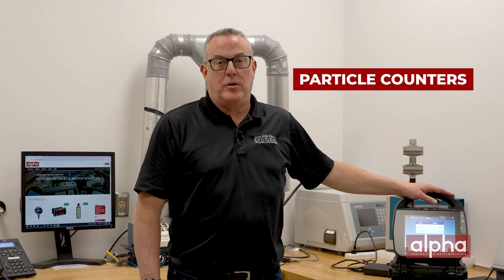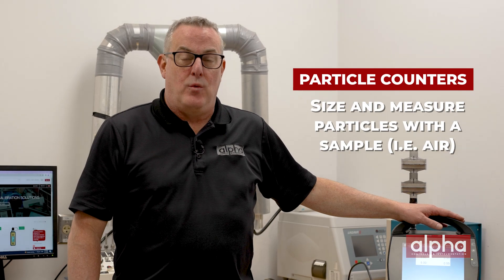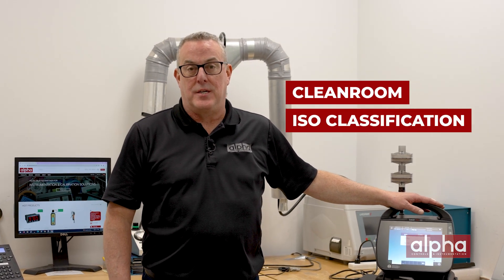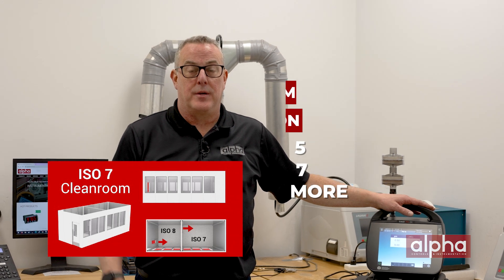Today we're going to be talking about particle counters. Particle counters do exactly that — they size and measure particles within a sample of air. They're used in a variety of different industries, but most commonly used to ensure clean spaces stay within their classification status, such as ISO 5, ISO 7, etc. Your classification status will determine the amount of particles you're allowed in each sample of air.